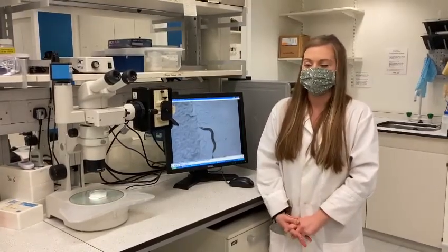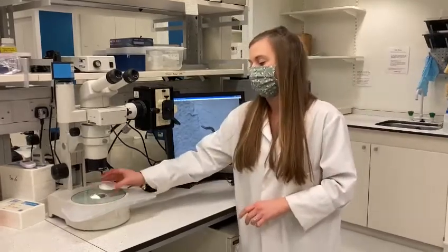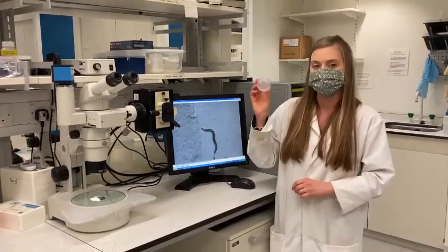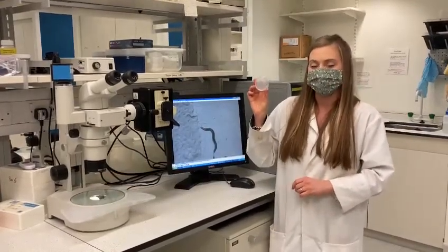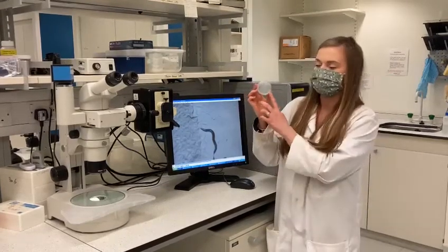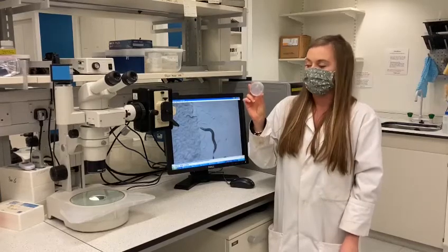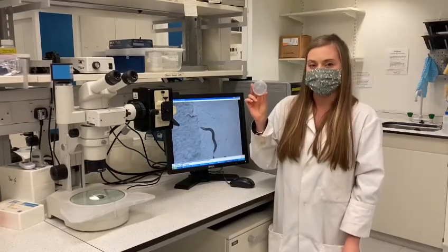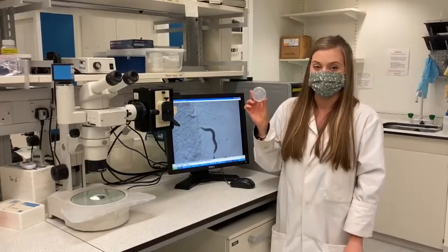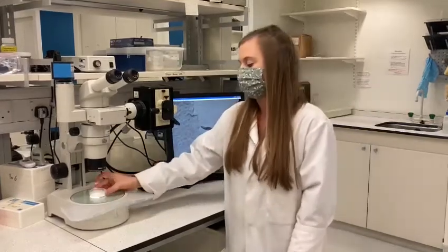C. elegans is a type of nematode that feeds on bacteria. We culture them in the lab on these NGM plates. You can get hundreds, even thousands of worms on this little plate, and they're very tiny — only one millimetre in length even when they're an adult — so we have to use a microscope in order to see them.